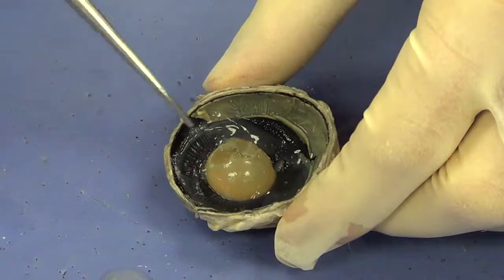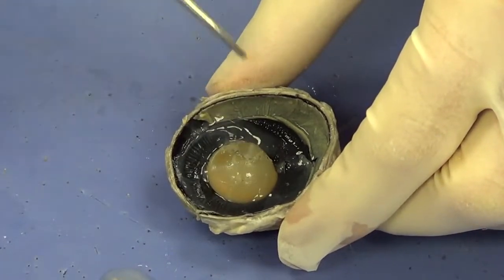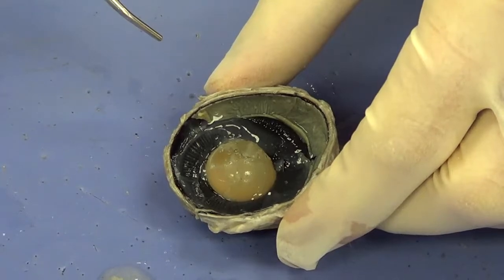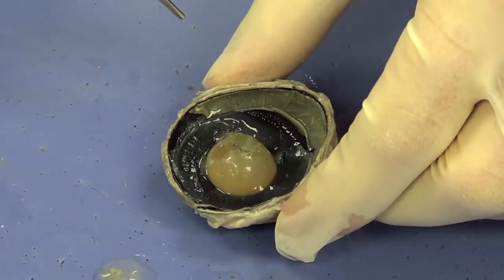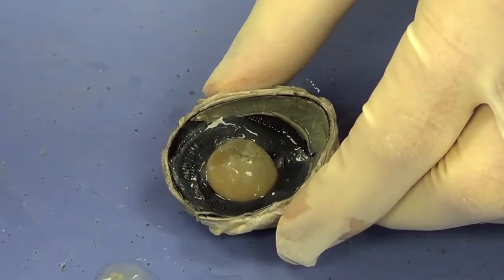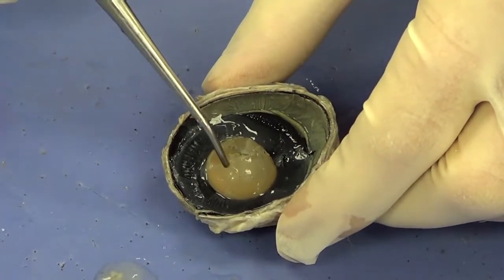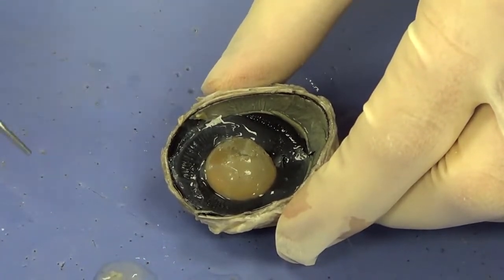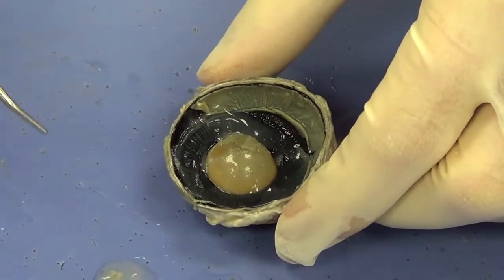Now, in a live cow, or you, this lens would be very clear, like glass. This one's hard, but in a living organism, this lens would be very soft. You could actually squeeze it like you could a contact. The preservative has denatured the proteins, made them cloudy, and made them very firm and rigid.